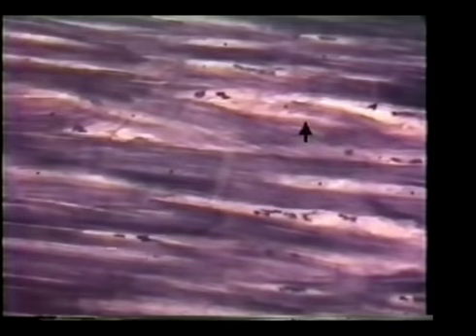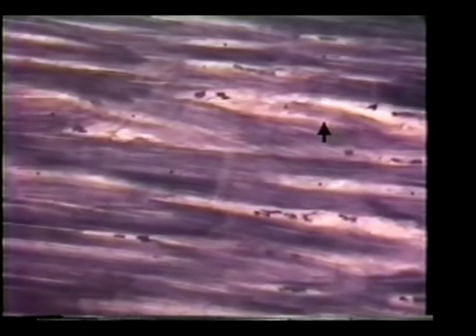We have cardiac muscle tissue on high power under the microscope. You can see the striations, up and down markings along through here, and right above the pointer here is an intercalated disc. This is that darkly stained striation, you might say. We have another intercalated disc about here. We have a nice intercalated disc right here.